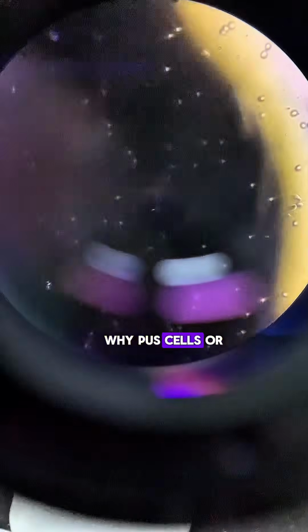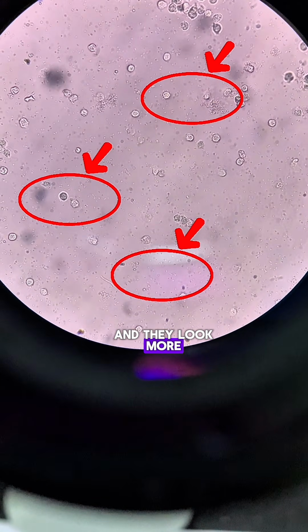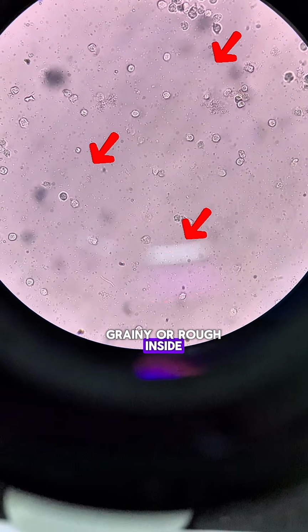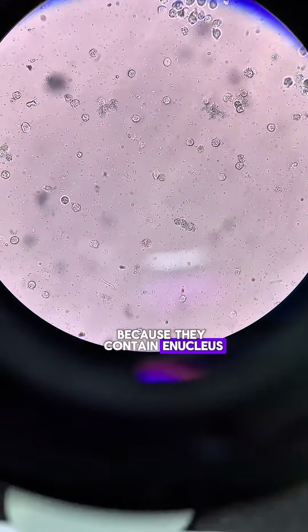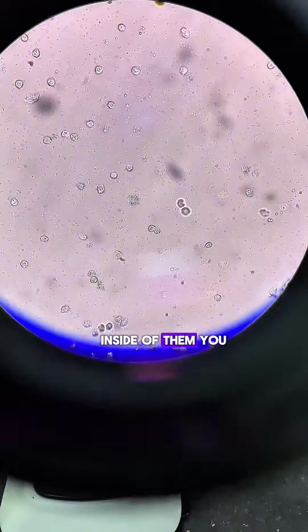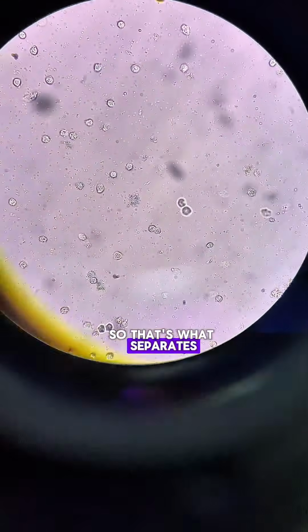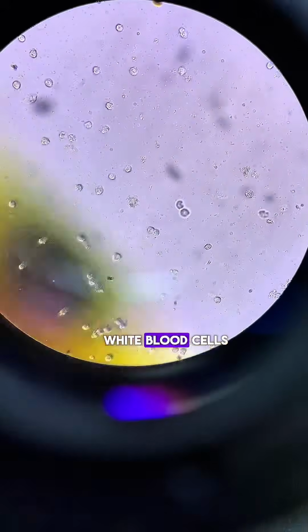While pus cells or white blood cells are slightly bigger and look more grainy or rough inside because they contain a nucleus. So for white blood cells or pus cells, inside of them you see tiny dots or granules. So that's what separates red blood cells from white blood cells.